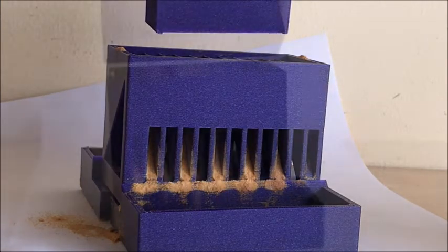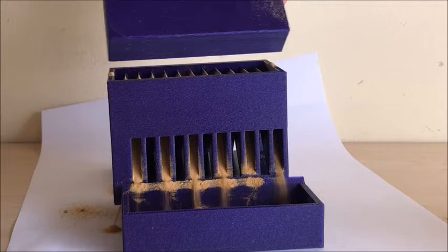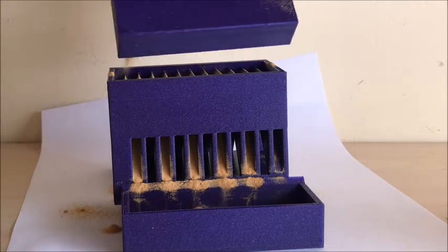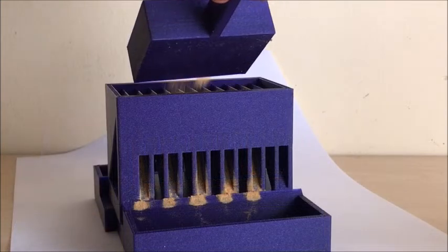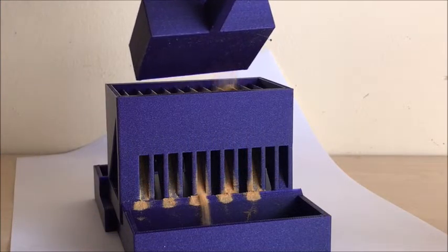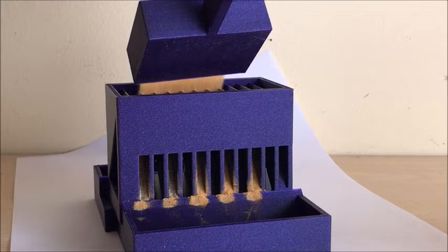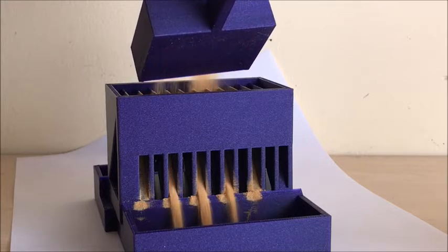The riffle splitter must be level so that approximately the same volume of material passes through each slot. It is good practice to alternate between the two sublots in order to mitigate any potential bias that may occur by always selecting the same sublot.